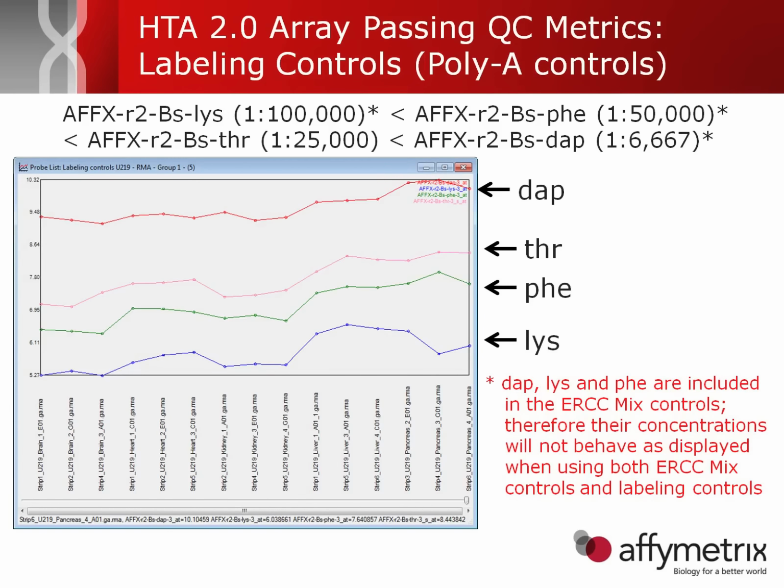For the labeling controls, also referred to as the poly A controls, there is again expected performance. Lys is expected to be the lowest signal, followed by Phe, followed by Thr, followed by Dap. One important note is that if you're using both the ERCC controls and the labeling controls, or the poly A controls from Affymetrix, they share Dap, Lys, and Phe. So if you put both of them together, the expected concentrations will not behave as expected.